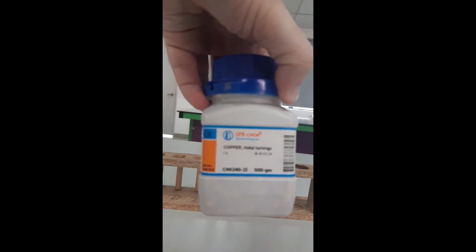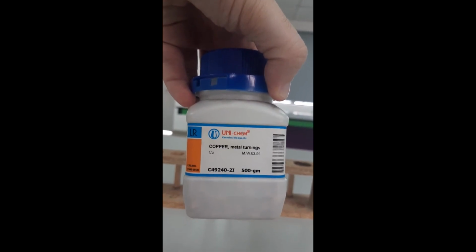Into the other tube, I'm going to place another piece of zinc metal from the same container. So again, a piece of shiny grey zinc. This time though, I'm going to add a piece of another metal in there as well. I'm going to add some copper. Copper is actually a catalyst for this reaction. It speeds up the reaction of zinc with sulfuric acid.